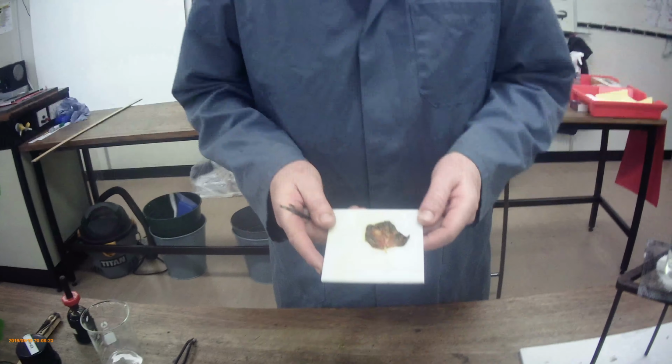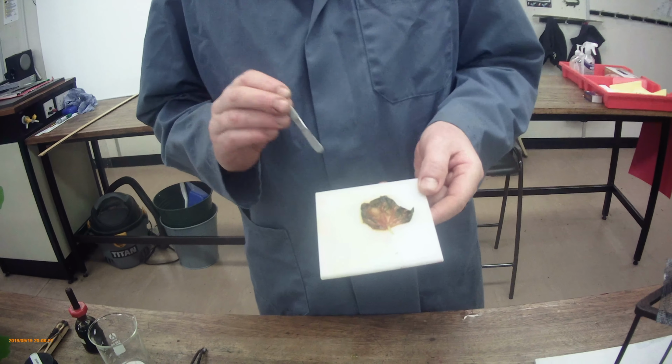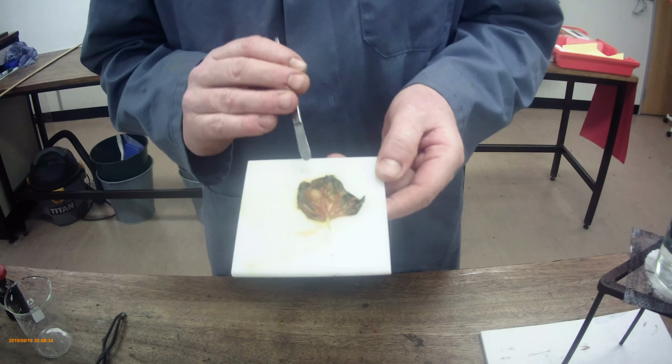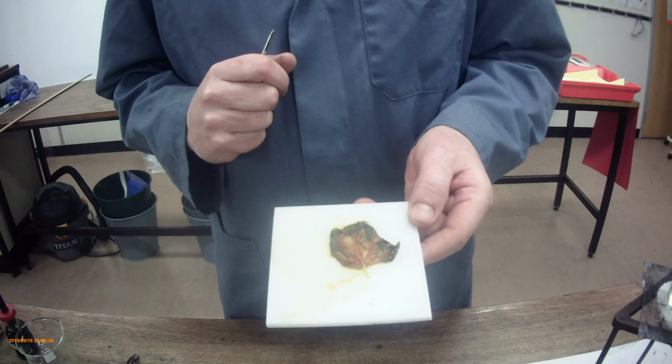If we repeat this experiment maybe later in the spring, 3 months' time, 4 months' time, we would expect a plant to be photosynthesizing much stronger, much more light, higher temperatures, and therefore we would expect a greater store in this leaf of starch. So not a great surprise that this leaf has not been photosynthesizing a lot. Small amounts of stores to see it through the winter, not a huge amount of photosynthesizing. So absolutely, at this point of the year, we'd say that was pretty good and backs up our understanding of photosynthesis.